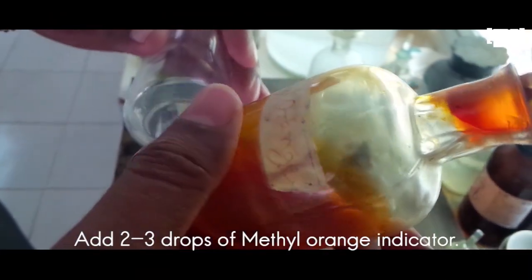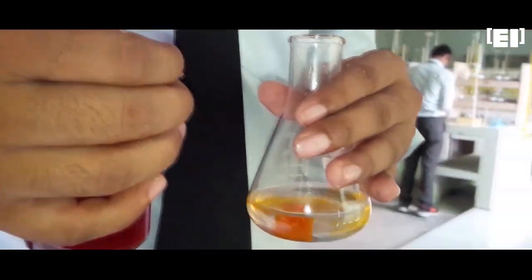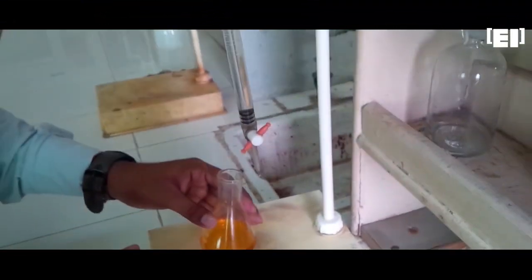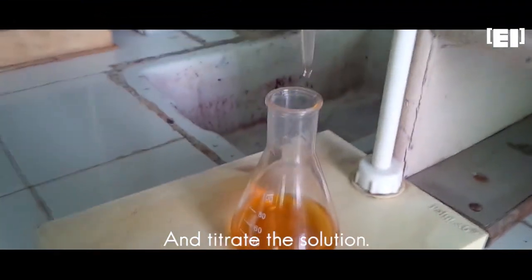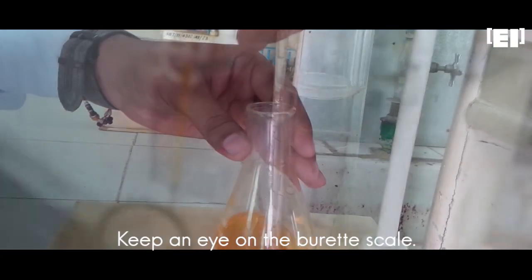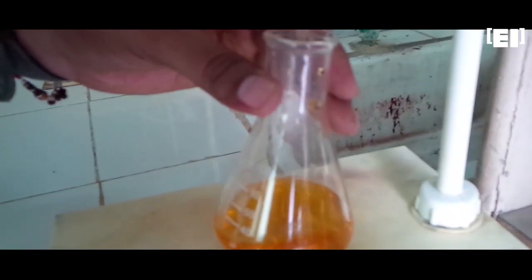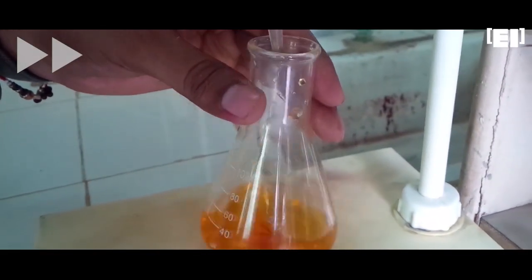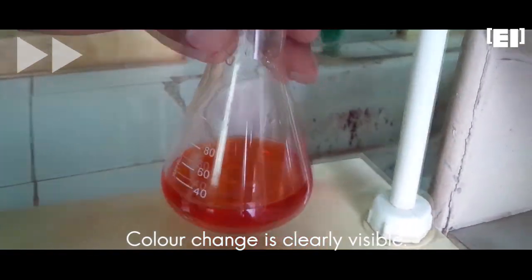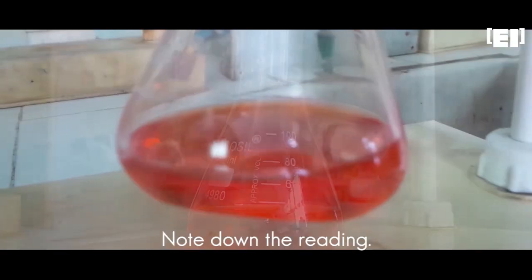Add 2-3 drops of methyl orange indicator and titrate until the bright red color appears. The color change is clearly visible. Note the reading from the burette scale.